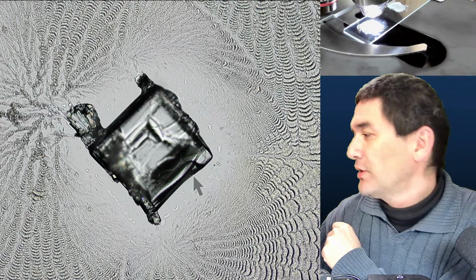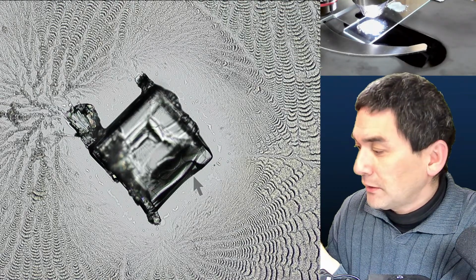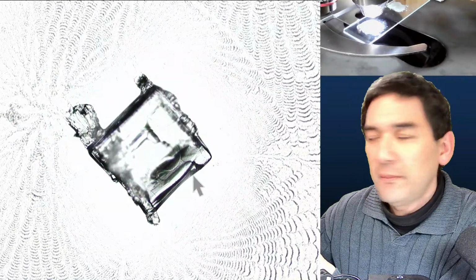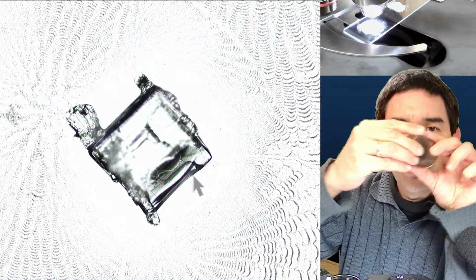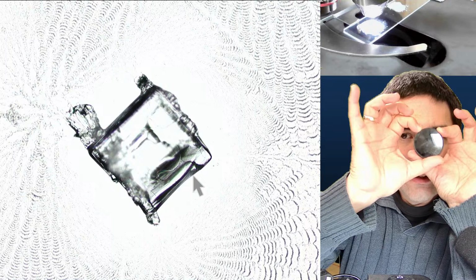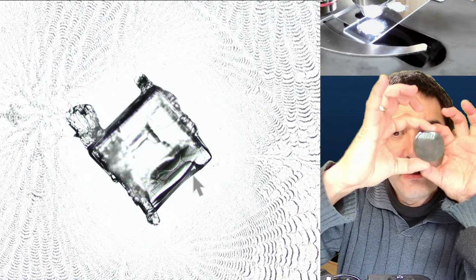Yeah? So what I'm going to show you now as well is the following. I do have built-in polarization and all these things, but what you can do as well is use polarization filters. Look what happens when you turn them. You can see that it becomes darker, and then brighter again. I don't know if you're able to see this, but it depends on how you turn it.